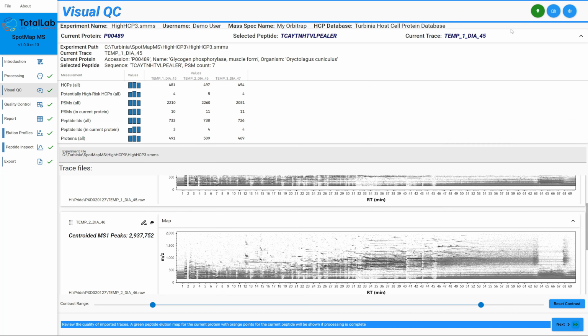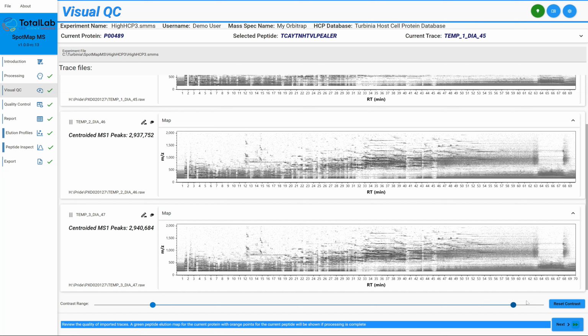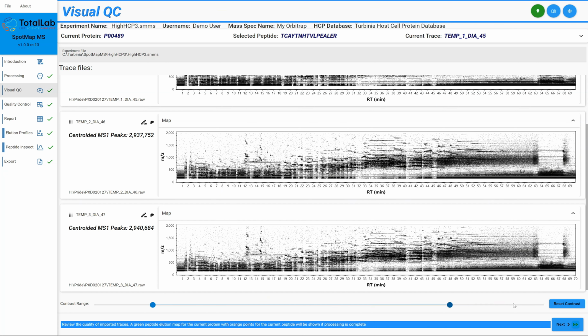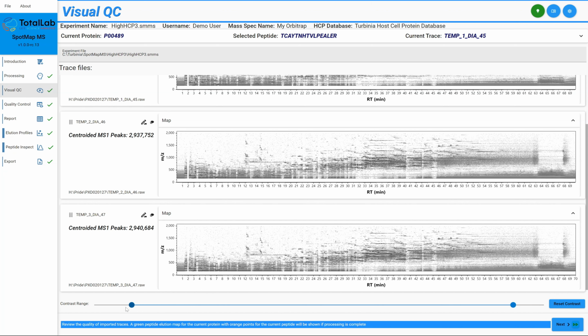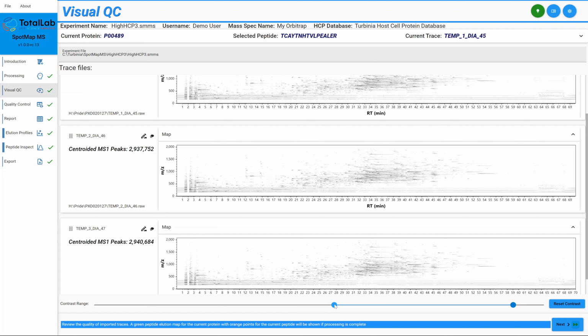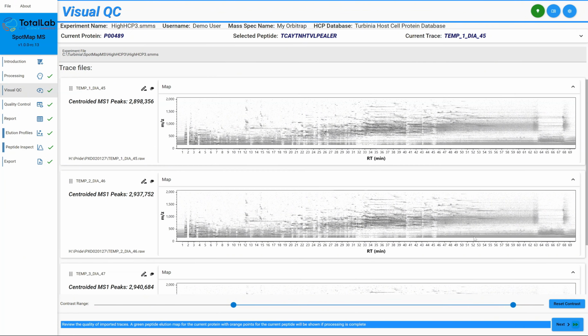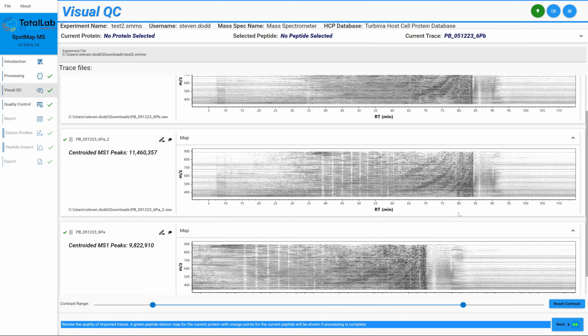From the top here, we've got some different QC measures as well. I might make a separate video on those, in fact. On the bottom here, we've got a contrast range, so we can change the contrast of these particular areas. The darkness of each area is relative to the intensity in that XY coordinate. You can change the contrast and highlight some areas. There's a lot of focus around this retention time at this mass over charge point. If we bring the contrast right down, you can see it's much higher than the rest of the trace. But this graph is not designed to show you the minutiae of everything. It's to give you a very quick visual check to say these things look like I expected and they look like each other.